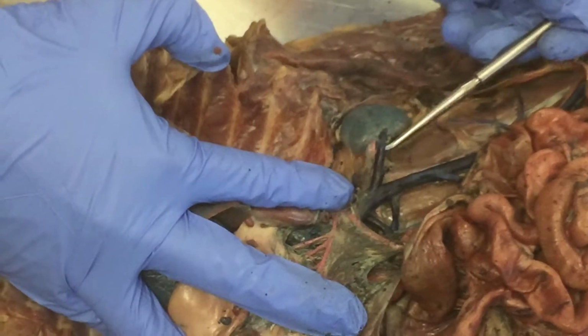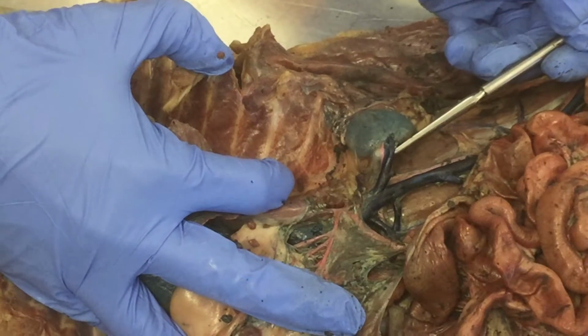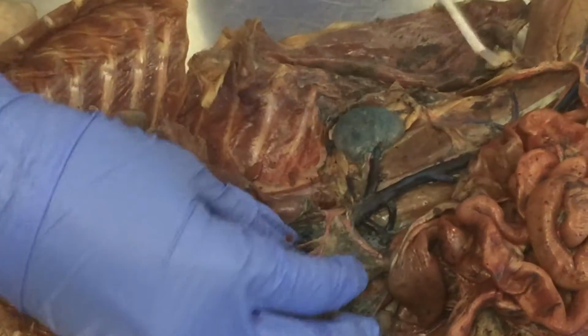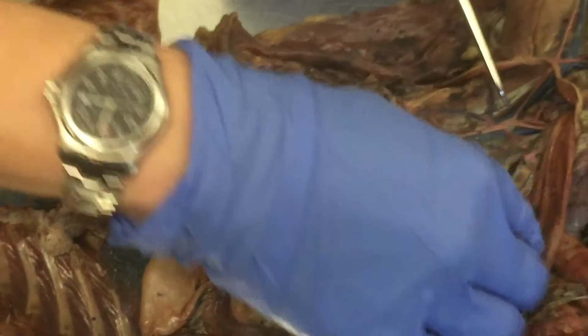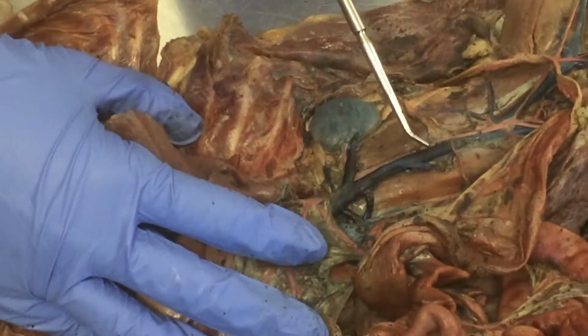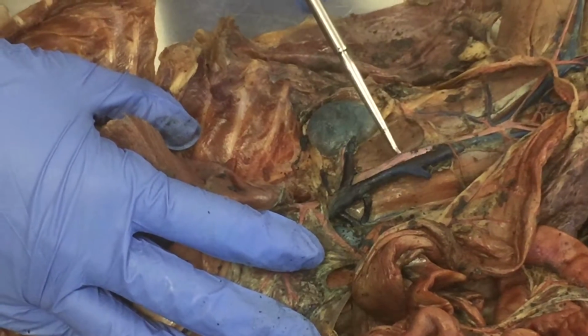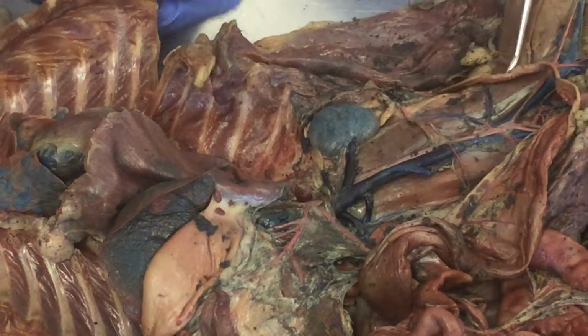So that means that these 2 are what? Renal. What side of the body? Left. Okay, don't forget your lefts and rights. Okay, then going down a little bit further. What's this big blue one here, though? IVC. And this big red one? Abdominal aorta. Abdominal aorta. Okay, I have a girl.